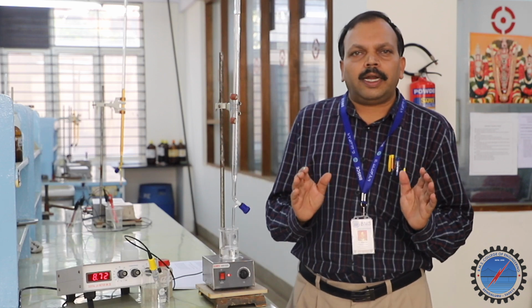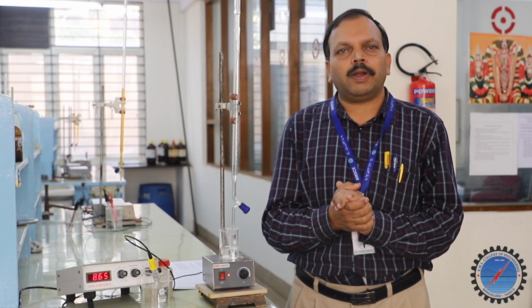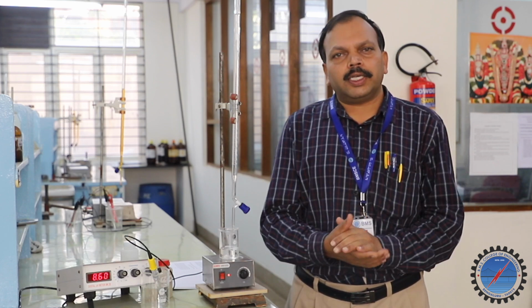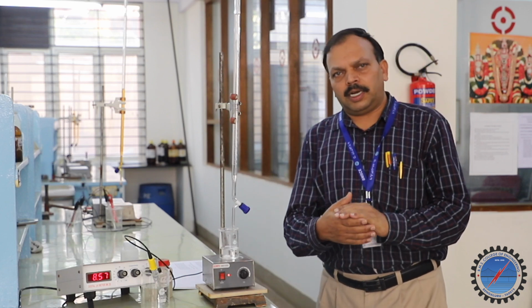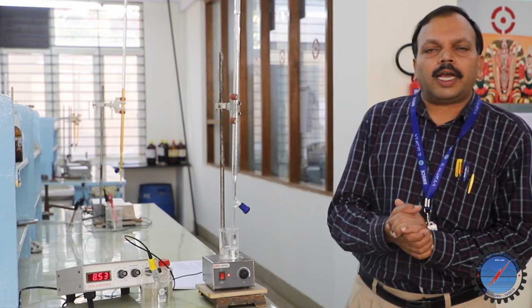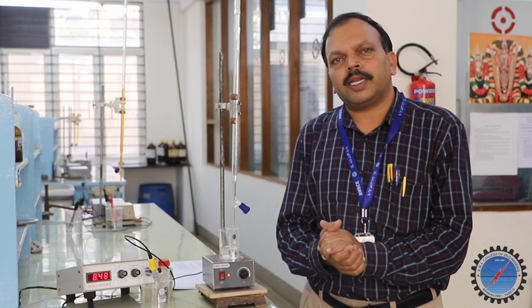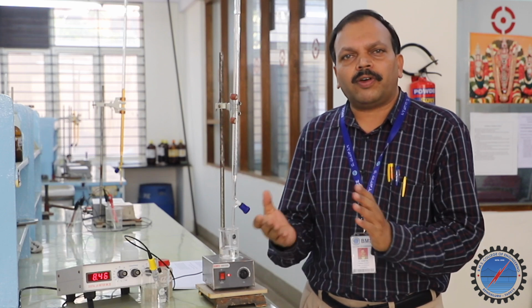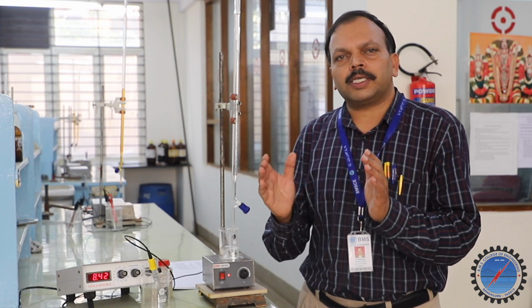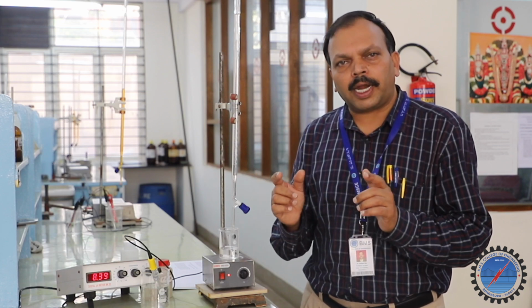See, the next idea is the principle of the experiment we are using here. There is the neutralization reaction, an acid-base reaction, and there is a sudden increase in the pH value. And next, we are going to use the Henderson-Hasselbalch equation, which you are familiar with from electrochemistry earlier, in buffer construction. That Henderson-Hasselbalch equation is pH equals pK plus log of [salt] to [acid].